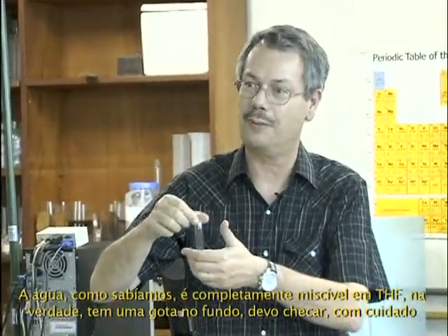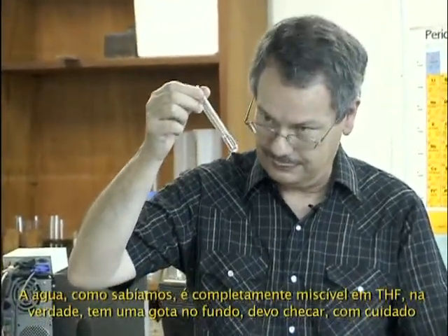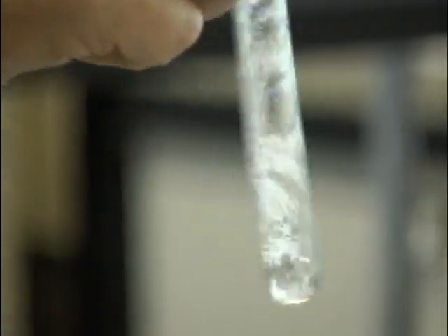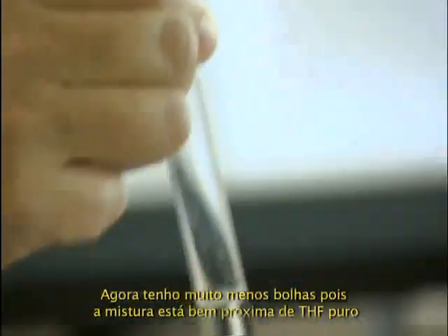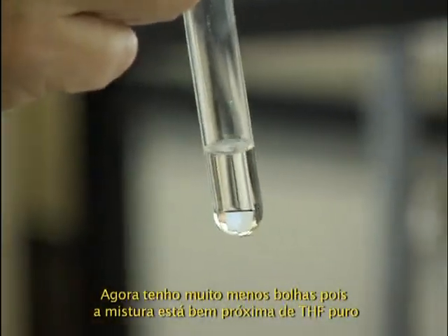Actually, it's just a drop at the bottom, and I should check it carefully to be sure I have a homogeneous mixture. I have much less bubble because this is very close to pure THF, 10% water in the THF.